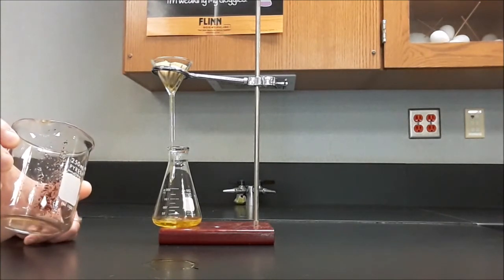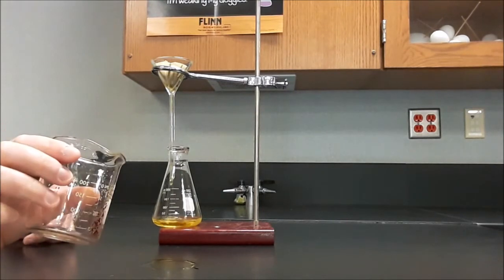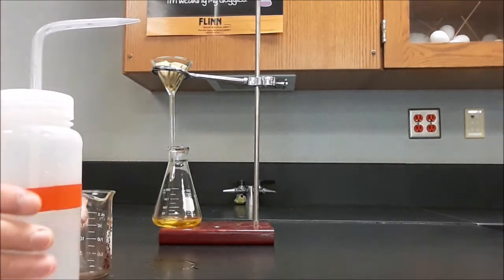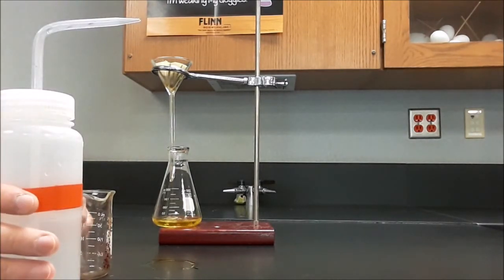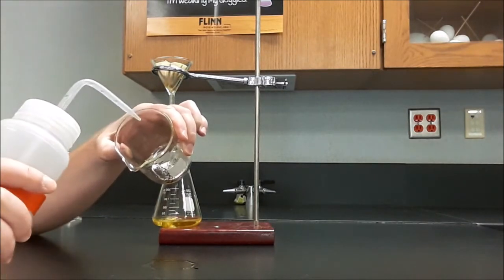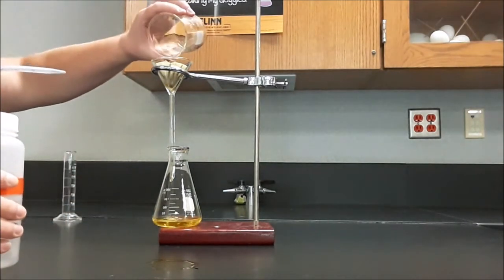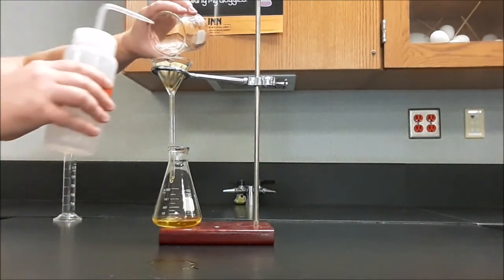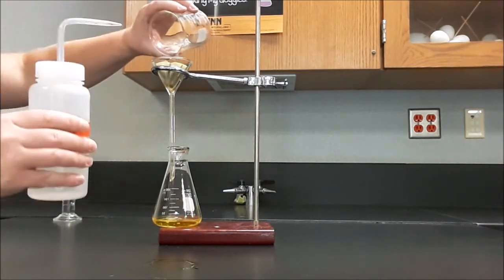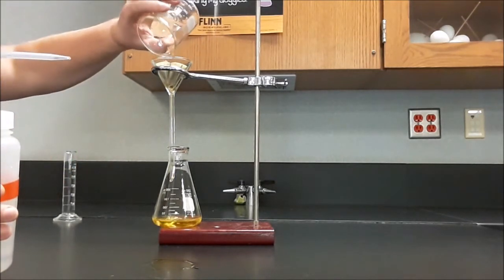Still a little bit of precipitate there. Going to want to try it again. At this point, you know, though, kind of getting a little impatient. So I'm going to grab a DI wash bottle and I'm going to tilt the beaker and rinse it into the funnel. So I'll just tilt the beaker over the filter paper and then rinse this in there. And you know, I think I got most of it.